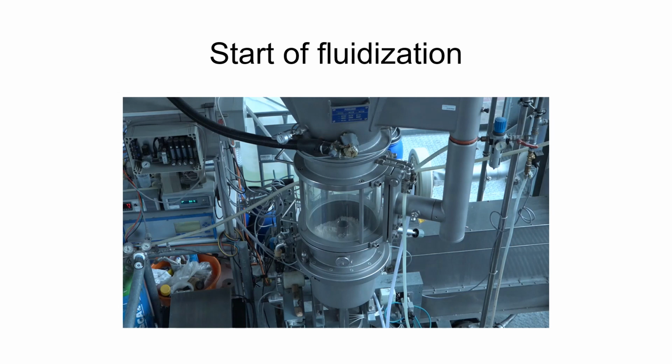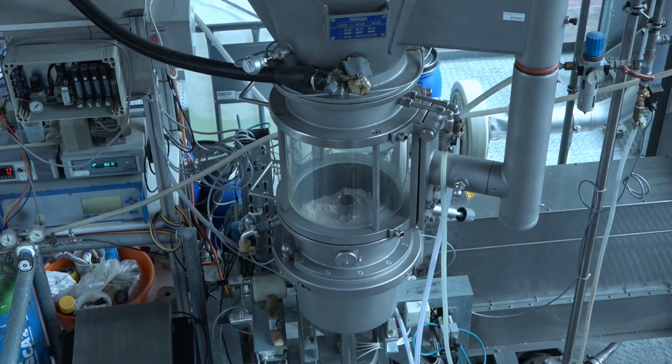So in the next movie I would like to show the start of the fluidization process. We have now some wetted material inside the process chamber, and you can still see the classifying tube. So let's have a look how it looks when we start the fluidization, when we switch on the ventilators.